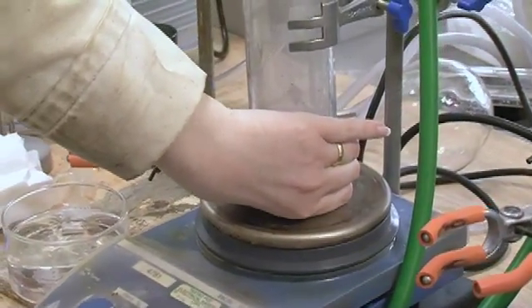So this is getting nice and warm now. The point is that the sodium is now more dilute, so it reacts more slowly. But because it's a liquid, you get a clean surface all the time, so that you don't get solid building up on the surface and stopping the reaction.